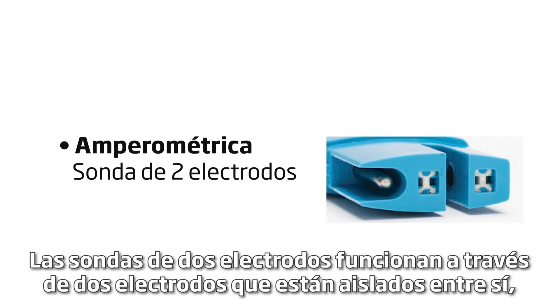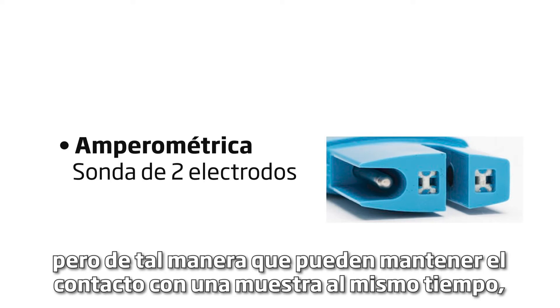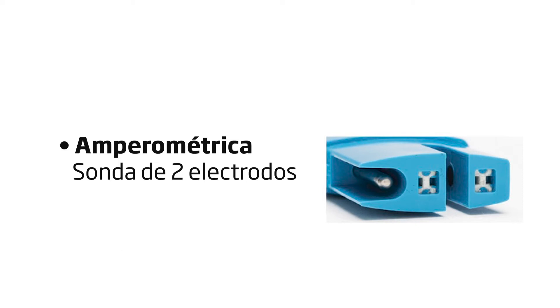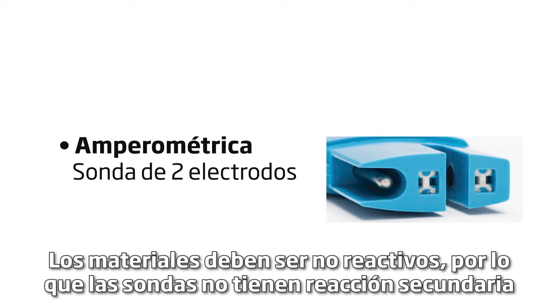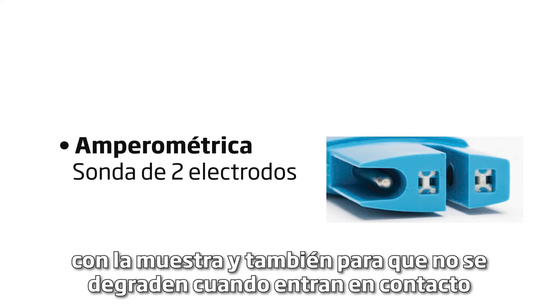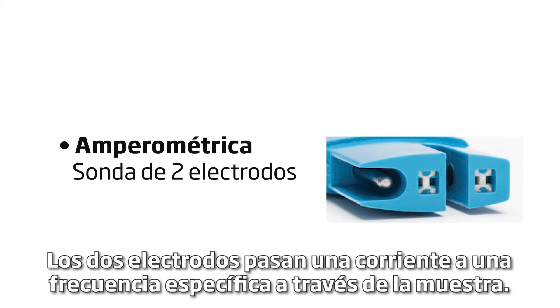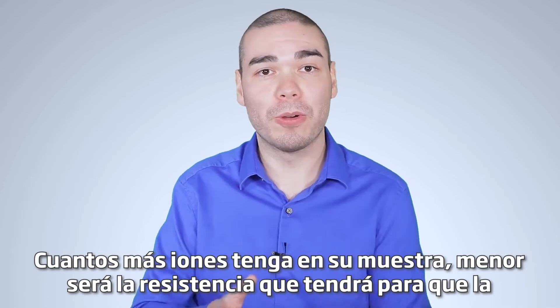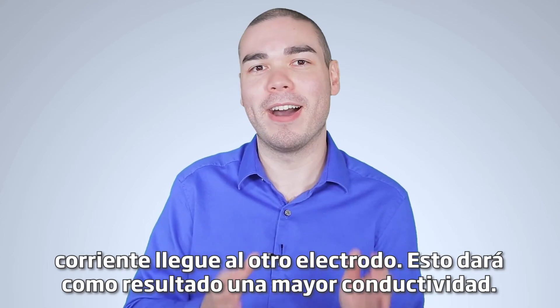Two electrode probes work through two electrodes that are isolated from each other, but in such a way that they can maintain contact with a sample at the same time. They're made from non-reactive materials such as stainless steel or graphite, so the probes do not have side reactions with the sample and do not degrade when in contact with the sample. The two electrodes pass a current at a specific frequency through the sample. The more ions you have in your sample, the lower the resistance for the current to reach the other electrode, resulting in a higher conductivity reading.